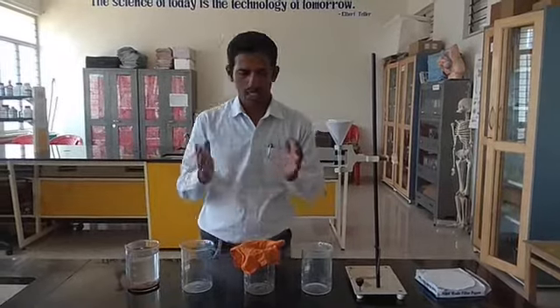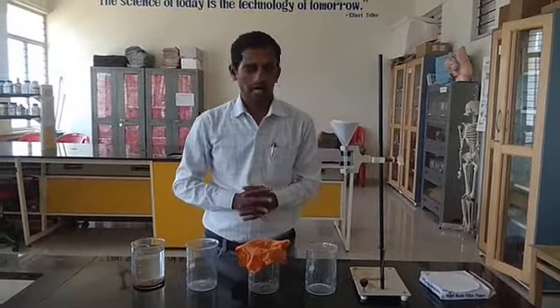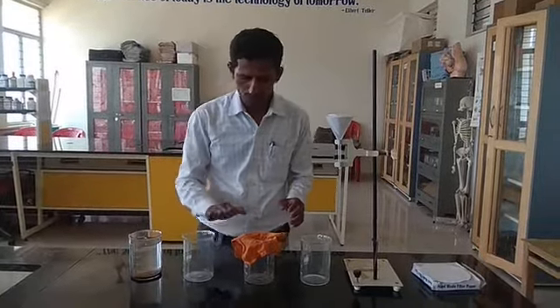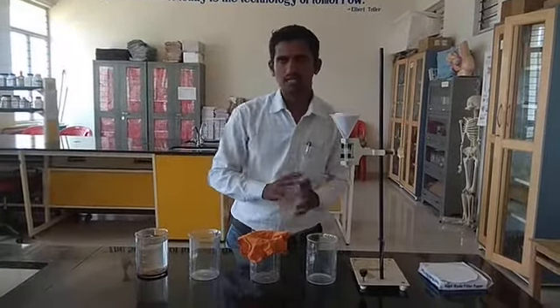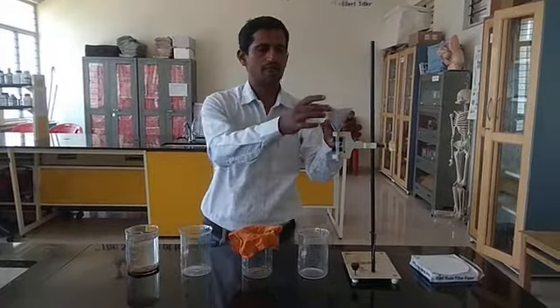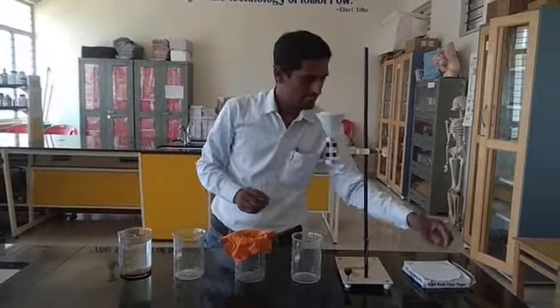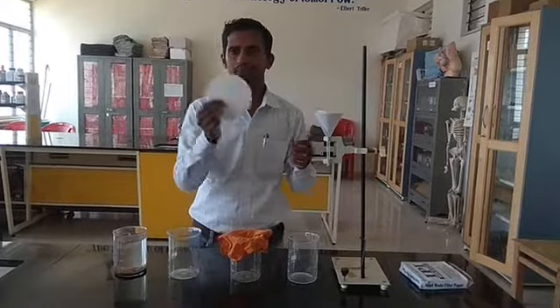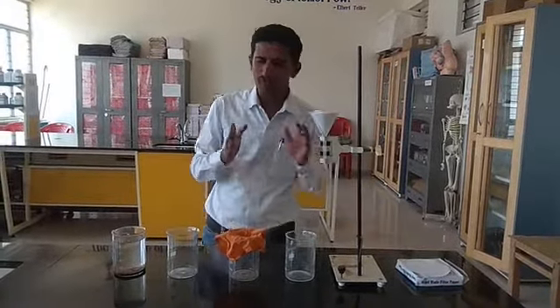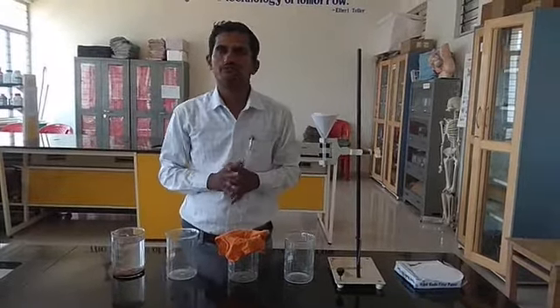Dear students, now I am at the lab. Here I have some instruments with me — four beakers, a stand, a funnel, and a filter paper. Now let us go through all three activities: sedimentation, decantation, and filtration.